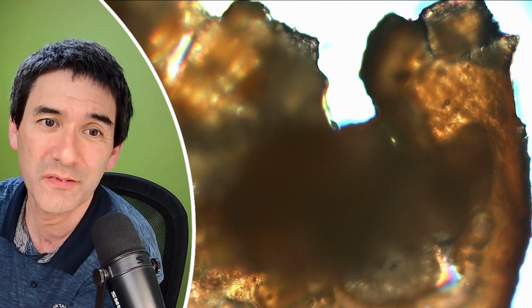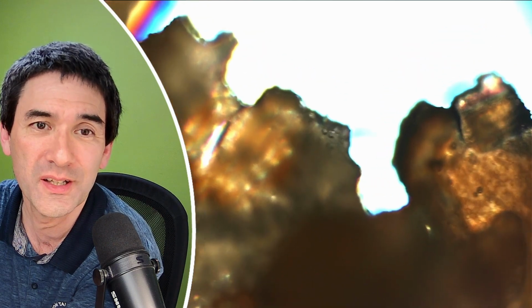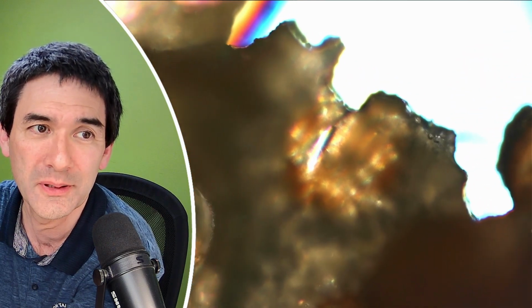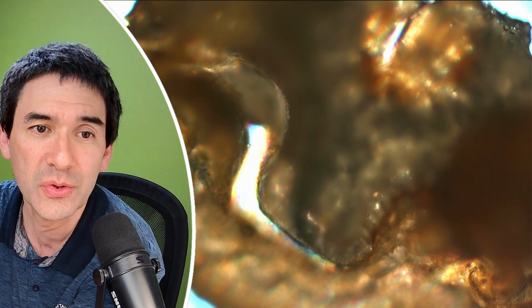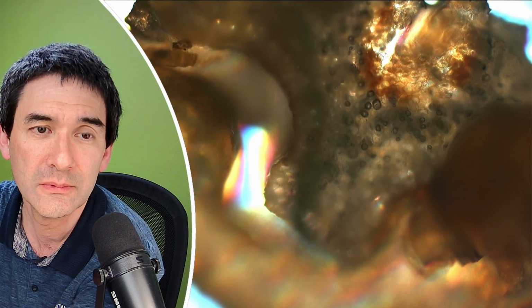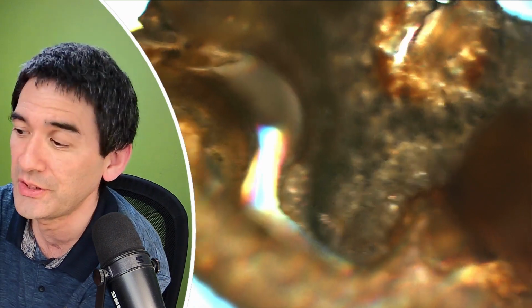So what I'll be looking at now is how dark is the specimen, because the darker it is, the thicker it is. Of course, there's always a little bit of a statistical variation. So this was cut with the first knife. You can see that the edges are a little bit ripped as well. If you look, you see the rainbow colors, that's because of the optics that I'm using right now. So basically, again, this is not using any mounting medium or water.